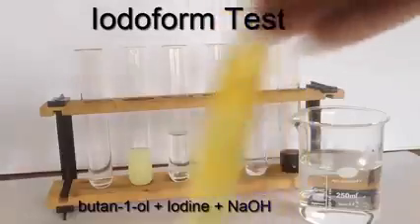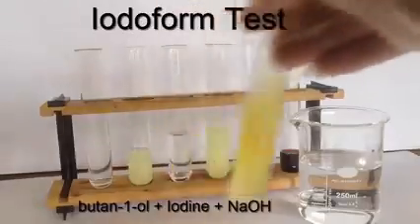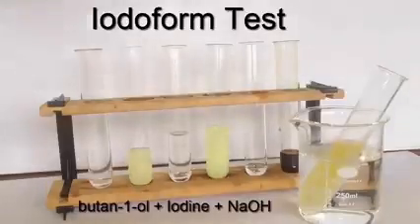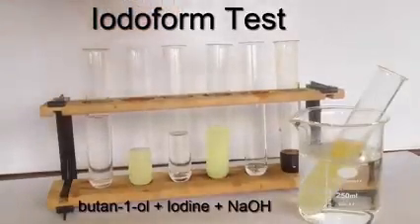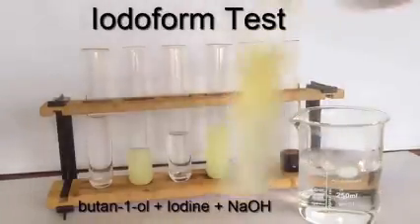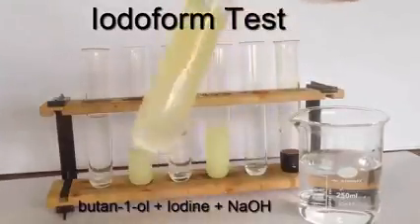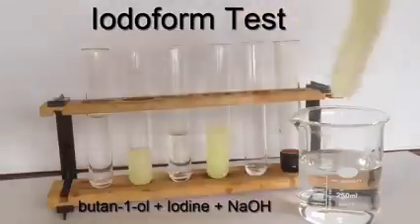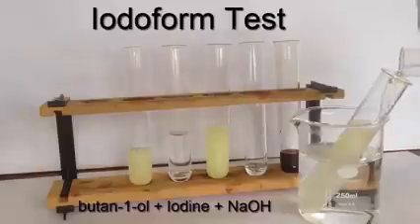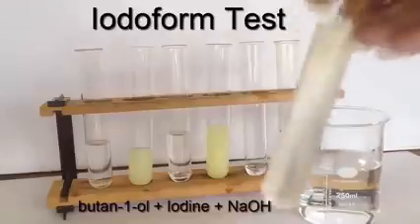I did feel the need to use the hot water bath in this instance to encourage it. Still not completely clear whether it's going yellow or brown at this stage, but watch it as it sits now in the hot water bath. And I did add a good bit more sodium hydroxide to get a result. I needed either it to go colourless and clear, or I needed it to go yellow and cloudy. I wanted one or other result, so I kept adding sodium hydroxide and warming it in the water bath. In fact, I found I had to add even more sodium hydroxide to get one result or other.